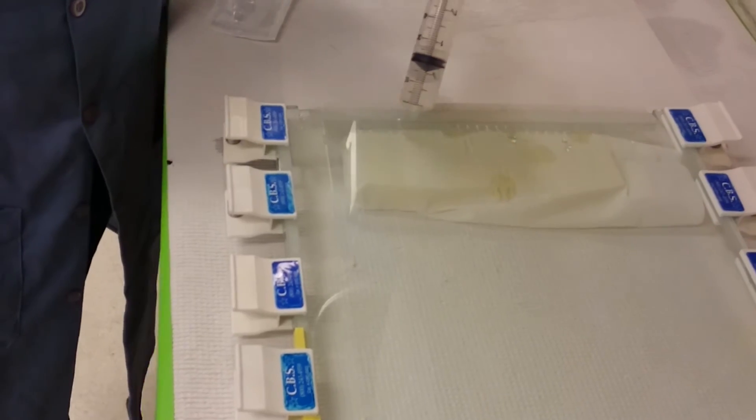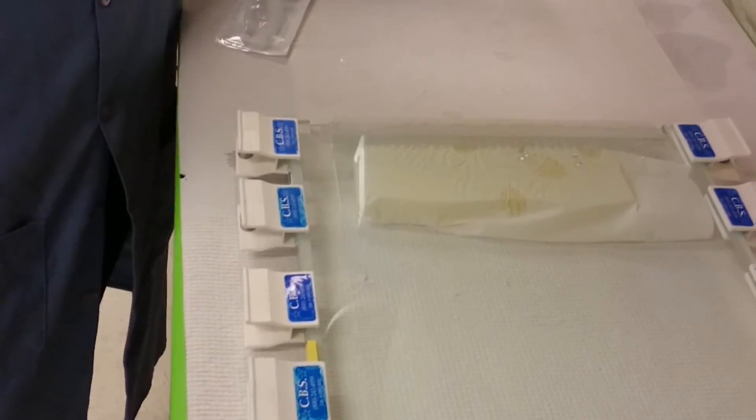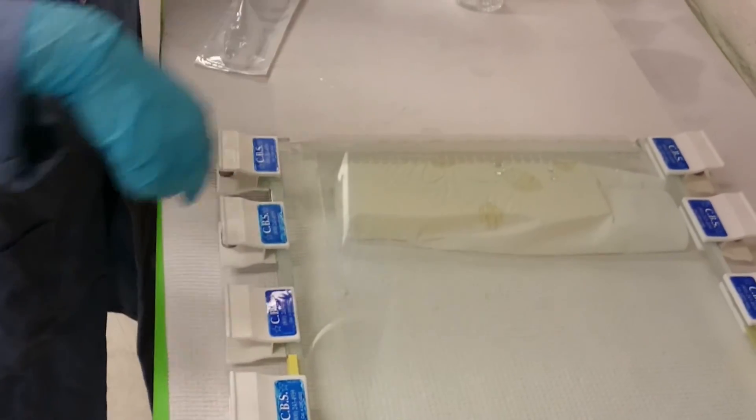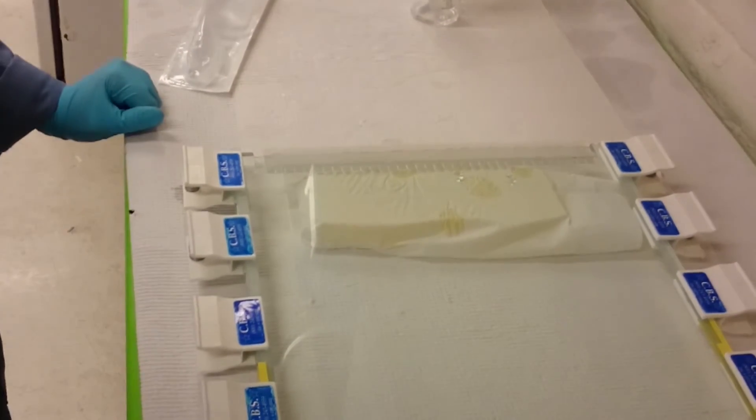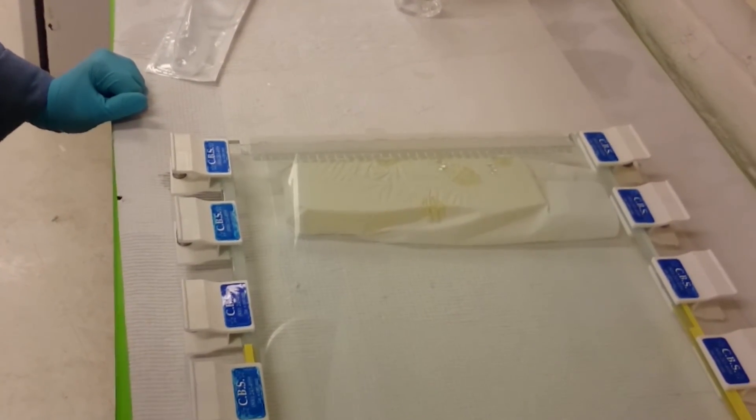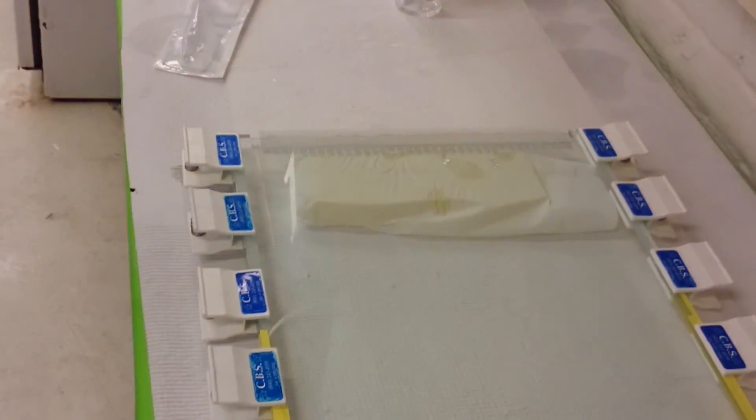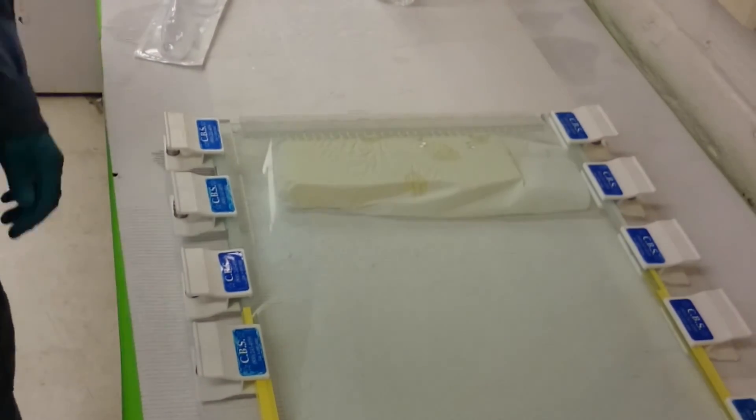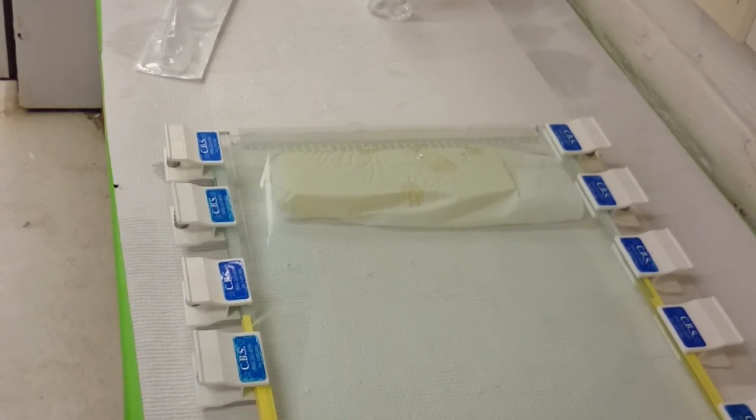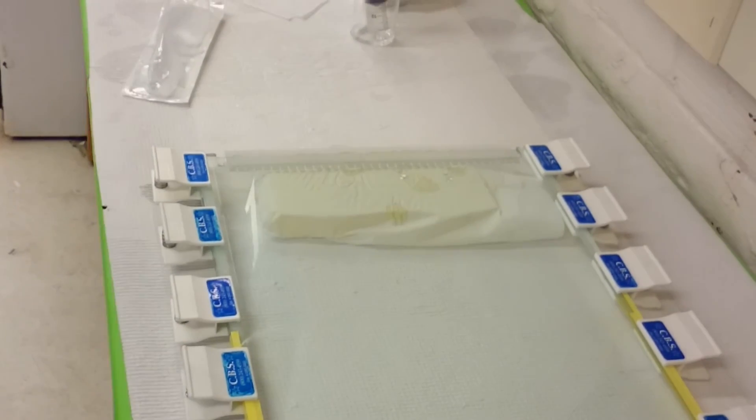All right, and now I'm just making sure that the entire width of the gel, the comb is covered with liquid and then we're good to go. It takes about an hour for these to set. And I'm just going to check back every 10 minutes or so to make sure that the comb is still covered with liquid.